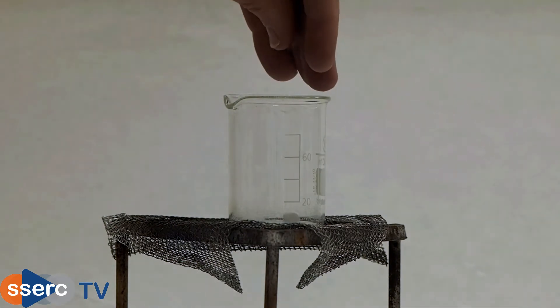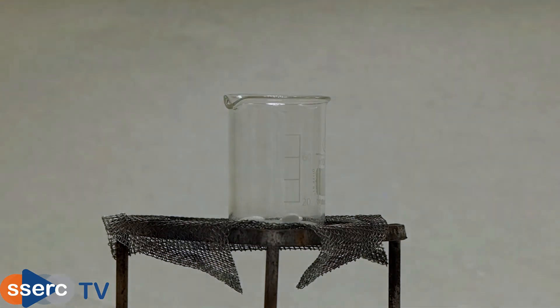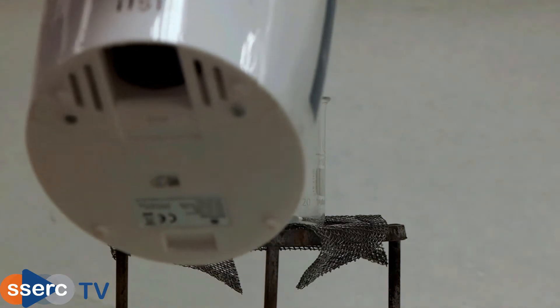Hi everyone, in today's experiment we're going to extract and purify caffeine from caffeine tablets.